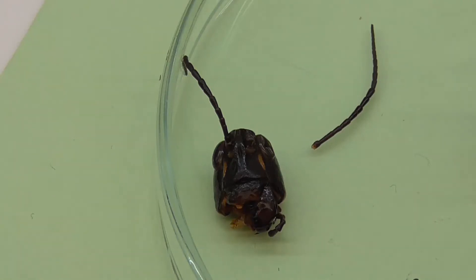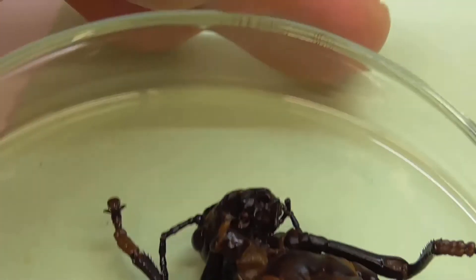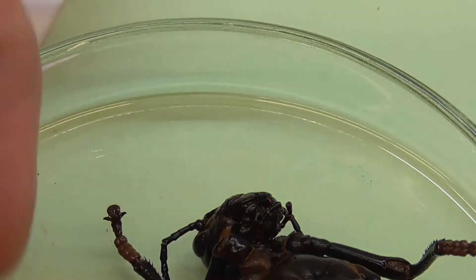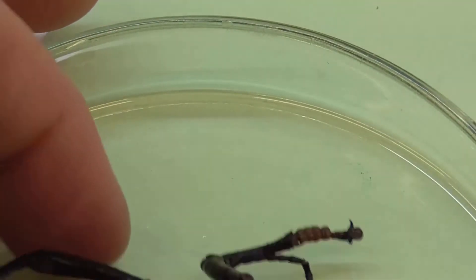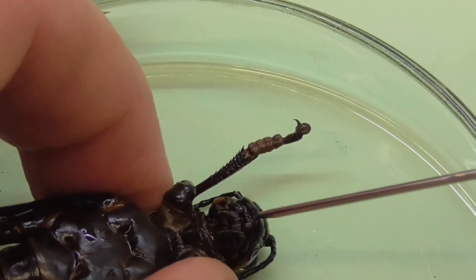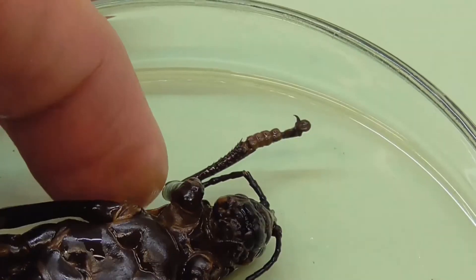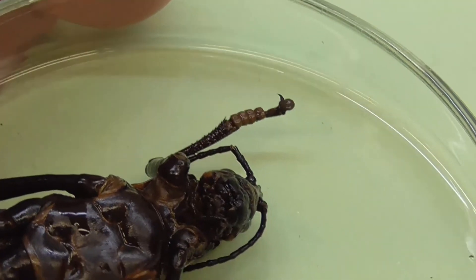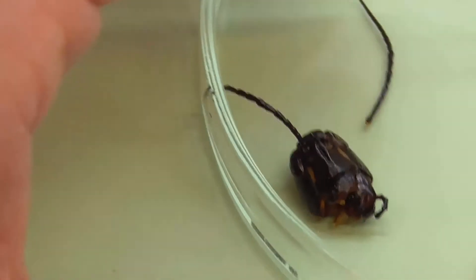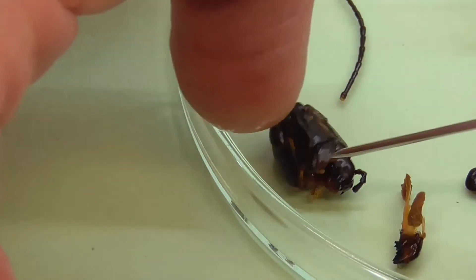Next, what we have are the mouth parts. Going back to the whole insect — looking at the mouth parts, you can see this little flap here. That's the labrum, which actually protects the mandibles. Taken off, that's the labrum there. On the far side, when you take that off, there's a mandible. You can see the mandible I've already dissected off here.